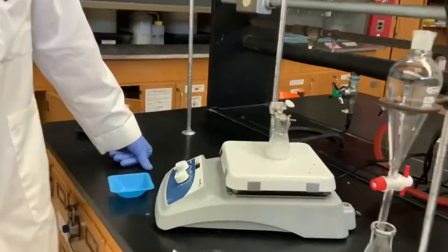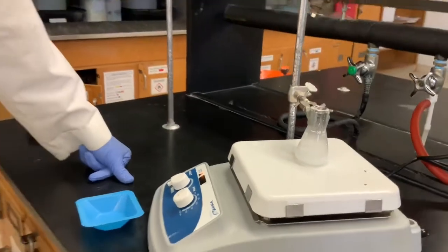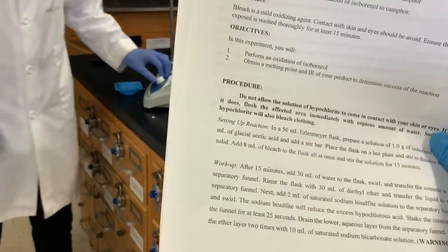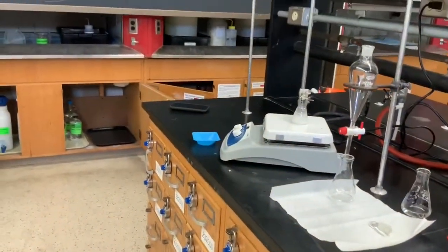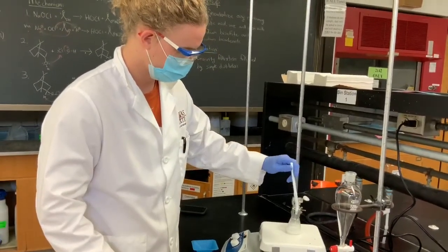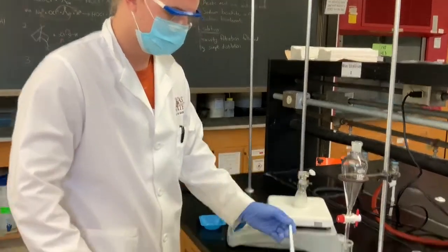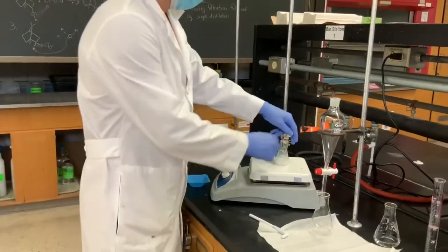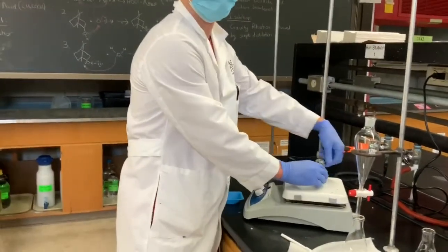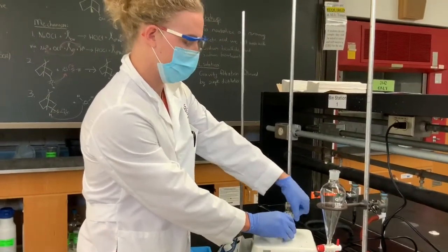All 15 minutes of reaction is over and we have white precipitate here. Next, we are going to do the workup of this reaction. This involves the removal of the stir bar.